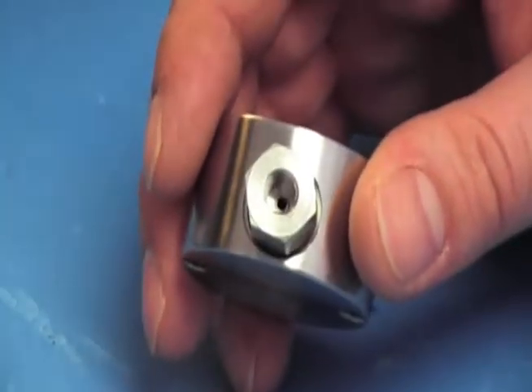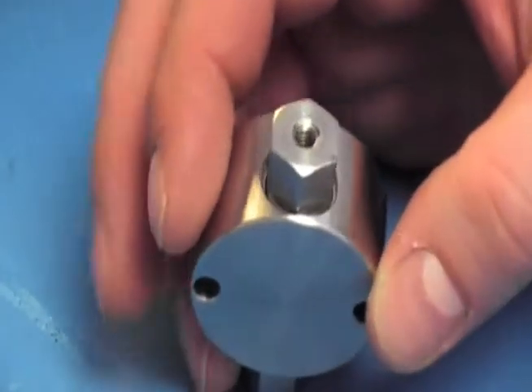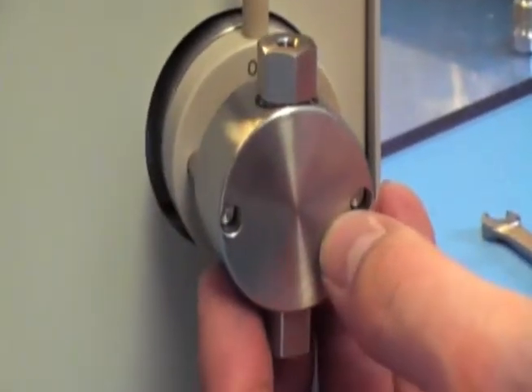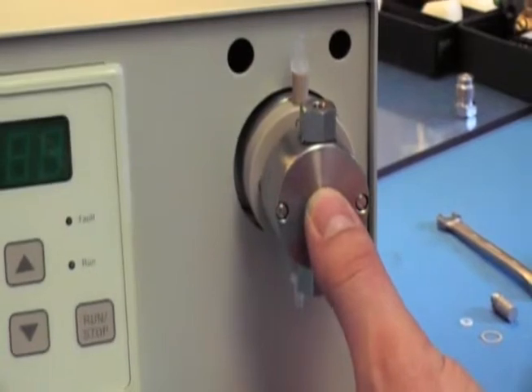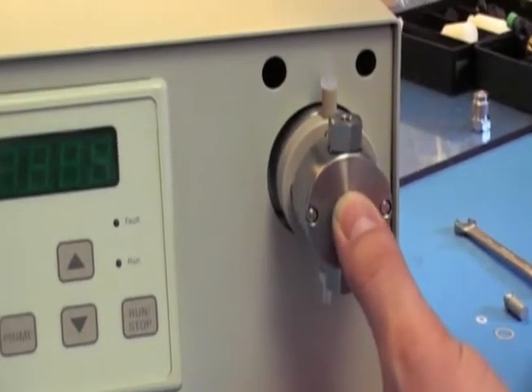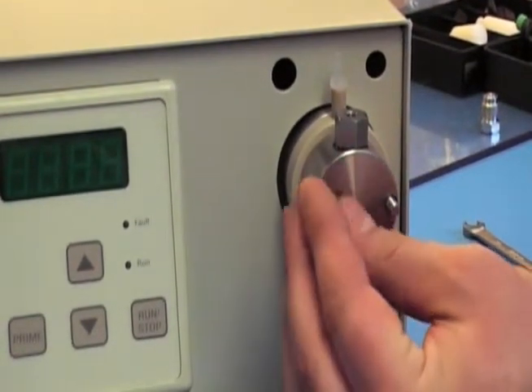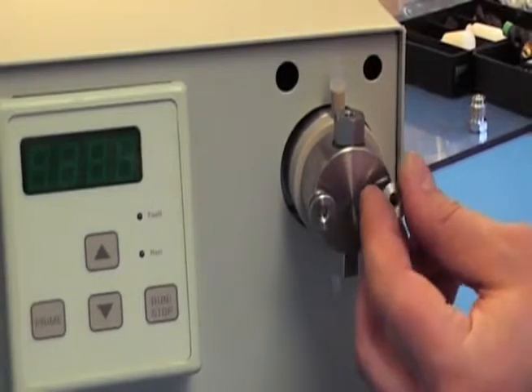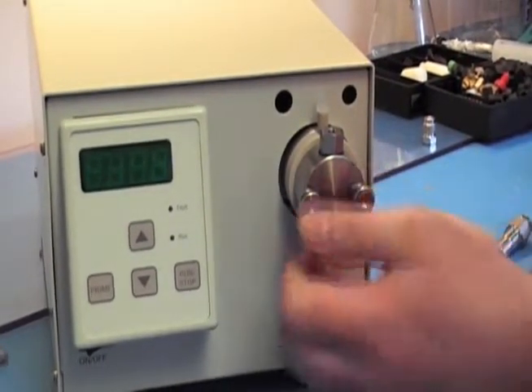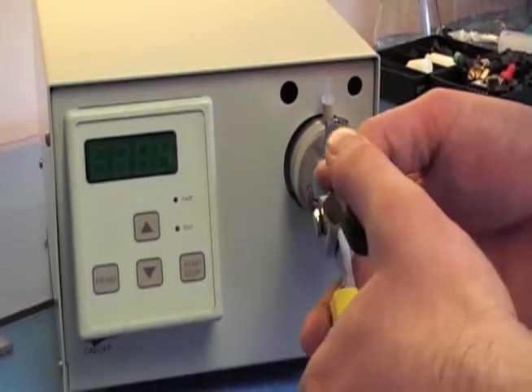The inlet is usually the bigger port, so that will be your inlet, and that will be your outlet. The outlet always goes up. Slot it on until you feel the head touch the piston in the back. Put your thumb in the middle in between the studs, hold onto the back of the pump because it takes a little bit of force, and press it on. Screw on your thumb nuts, make them finger tight, then put your pliers on for a quarter turn past when you're tight.